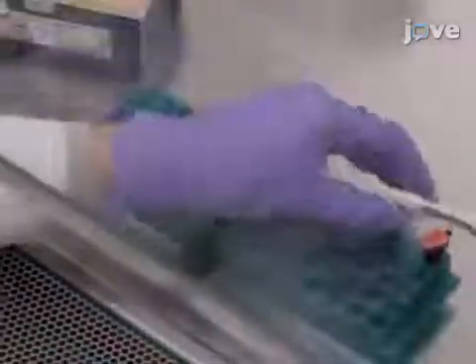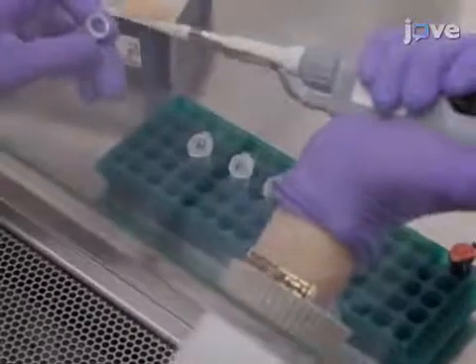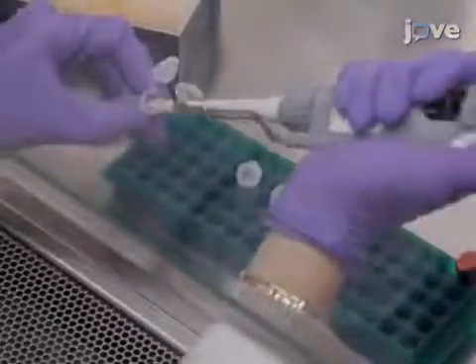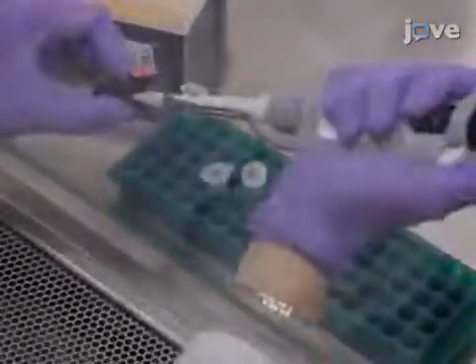For the probe treatment, add 16 µL of DMSO to one tube, and 16 µL of 50 micromolar photo affinity probe to the other tube.